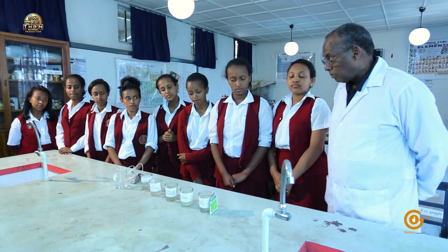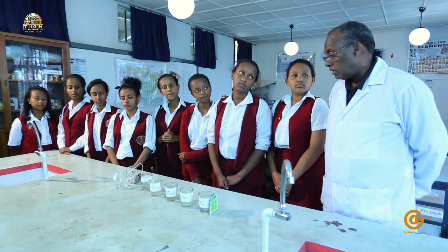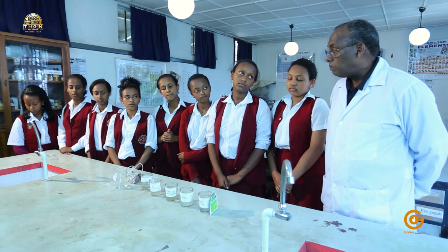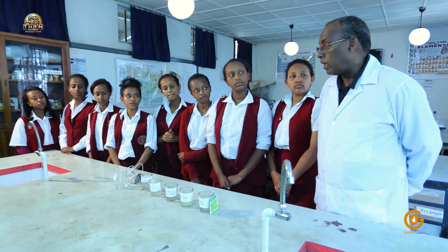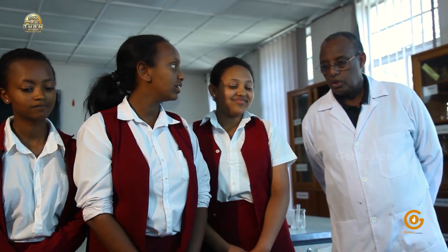Today's demonstration will help us see if the bonds are either covalent or ionic. If the bonds are ionic, there are freely moving charged particles that would complete the circuit, which otherwise would not conduct current. So from here on, you try to explore what kind of bond you have in the following solutions. Ready? You could start. Thank you.